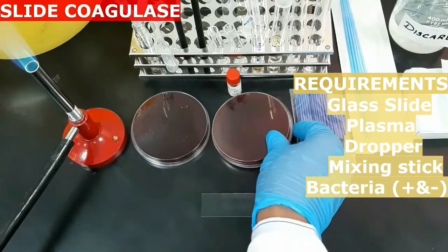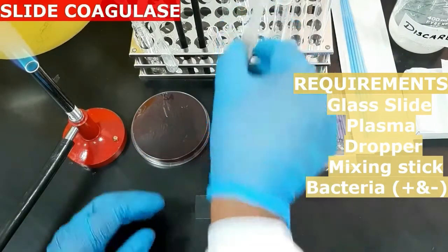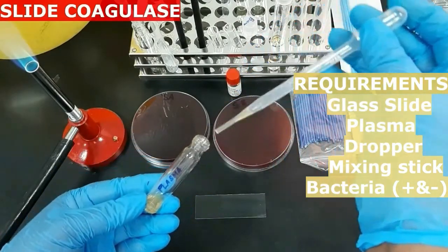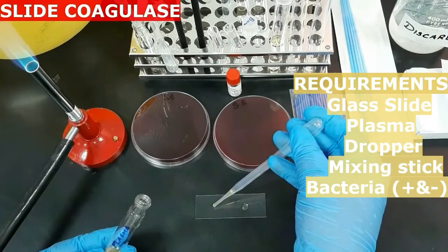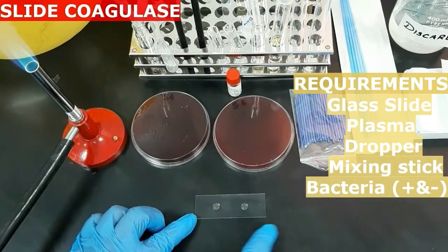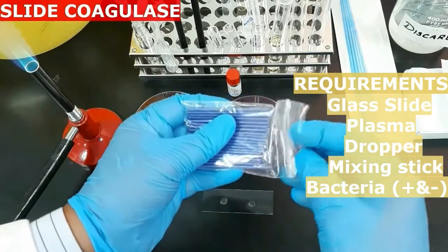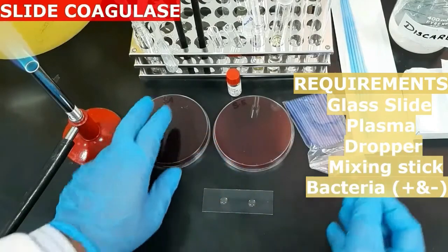So let's start with the procedure. Take a clean glass slide and add a drop of undiluted plasma to both ends of the slide with the help of a dropper. Then with the help of a sterile mixing stick, transfer the positive control bacteria to one of the drops and emulsify it.